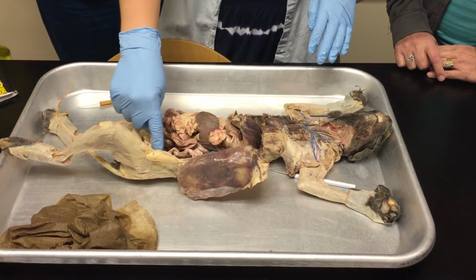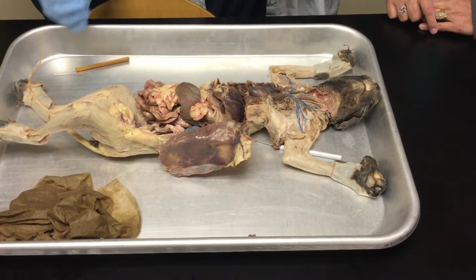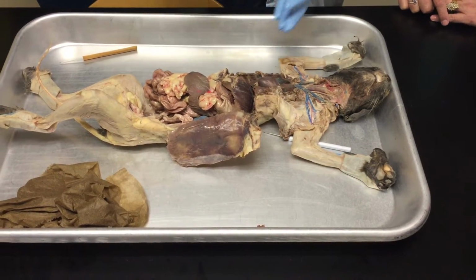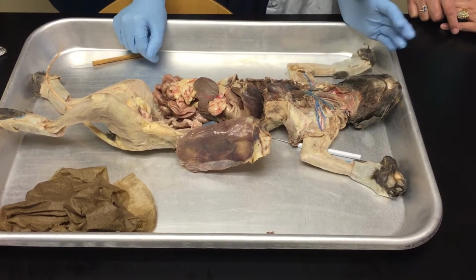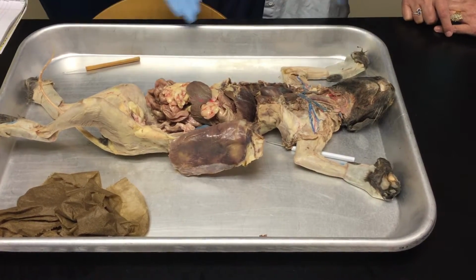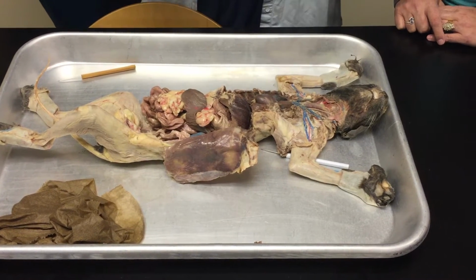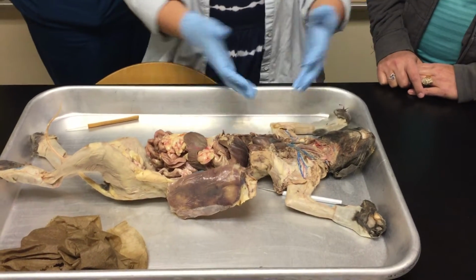And then you'll see when we get to the iliacs, at the lower part of the pelvic cavity, abdominopelvic cavity, it reverses and the arteries are on top of the veins. Veins are much easier to see because they're larger, they hold more dye, and that's because if you have learned about the structure difference between arteries and veins, veins have a much larger lumen, they're much larger vessels, so they hold more of the dye and they're much easier to see.